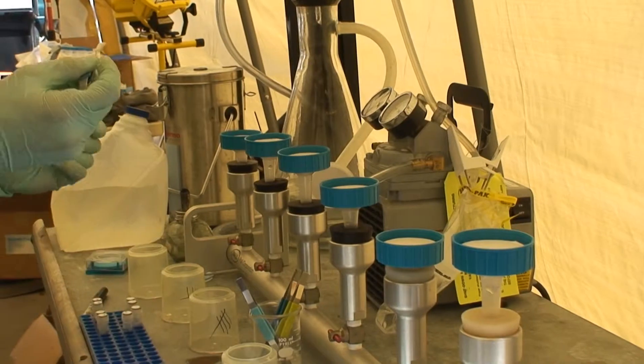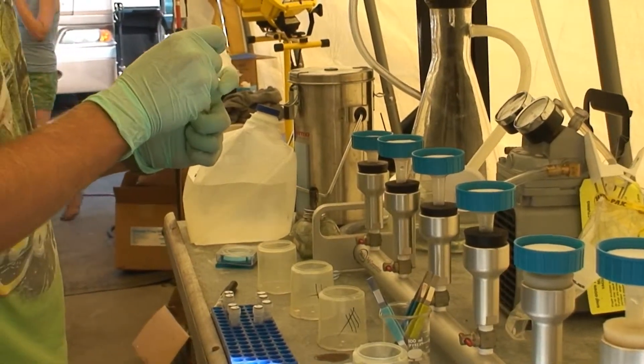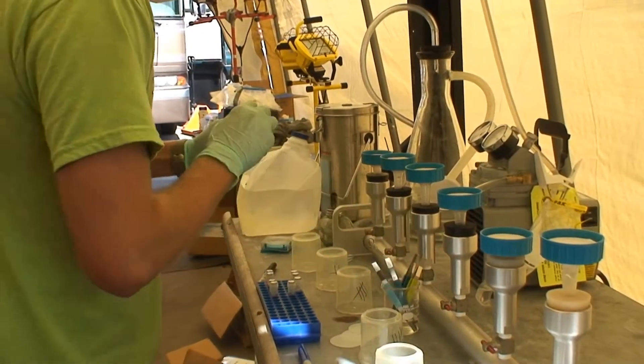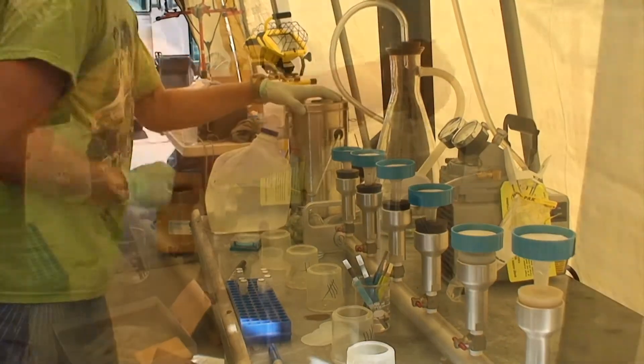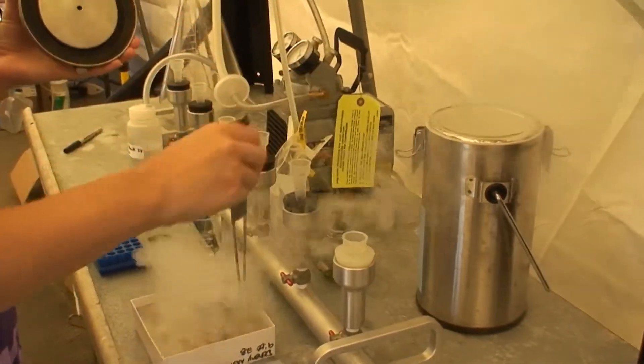When using molecular methods, we're actually looking for genetic markers of the bacteria rather than trying to grow them. In this case, we filter the bacteria in the same manner, but then we freeze that filter for later analysis.